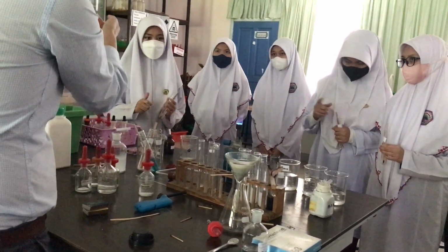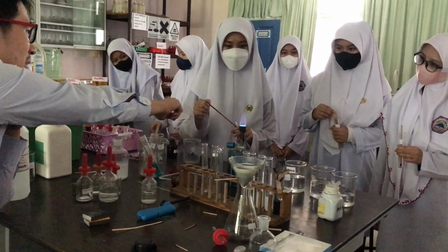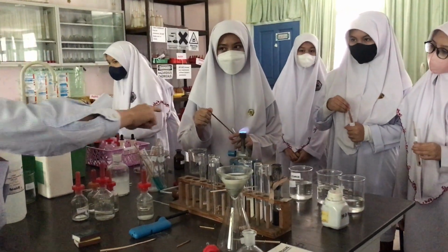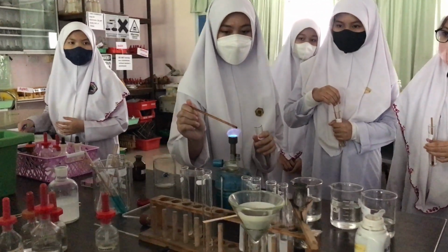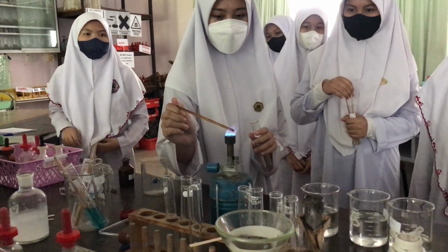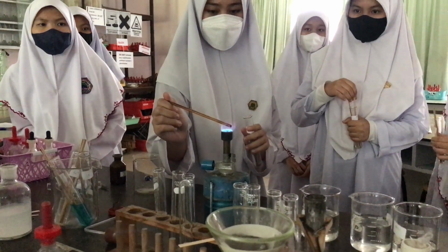Who is the lithium? Lithium. Come. So blue flame. Okay, lithium ion. The stick has got lithium on it. Okay, lithium plus. Have a look at the color. Yeah, just put it on top of the blue flame. Everyone try and see the color. Yours is lithium. I'm going to turn off the aircon for a bit.